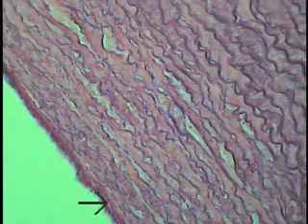This particular preparation is a section of the aorta that has been stained to demonstrate the elastic laminae. The intima is shown at the pointer, again consisting, at this relatively low magnification you can't see it very well, of an endothelium and an underlying small connective tissue which forms the rest of the tunica intima. So the tunica intima goes right about to where the tip of the pointer is. The intima is relatively thin, consisting of an endothelial layer and then the intimal connective tissue that supports it.